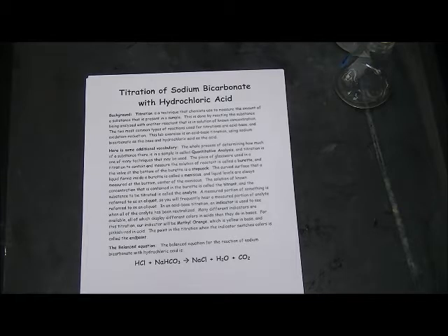Good morning! The purpose of this video is to help you complete this laboratory exercise, titration of sodium bicarbonate with hydrochloric acid.